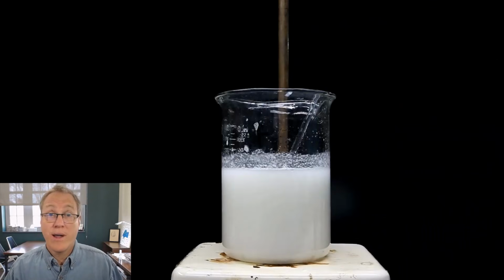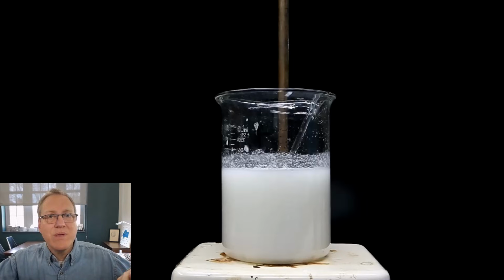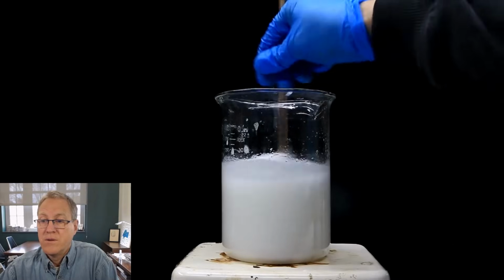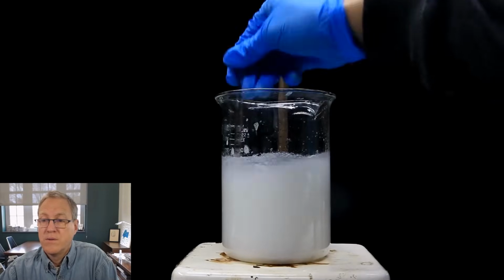That is a quite high pH. This is definitely on the basic end of the scale. Notice he does have solids in there. As he swirled this around, some of the solids have kind of slopped up on the side of the beaker. That's okay. He's going to be able to get them, but there's definitely solid in here. Once the pH of 14 is achieved, almost all of the lidocaine should exist as the free base.